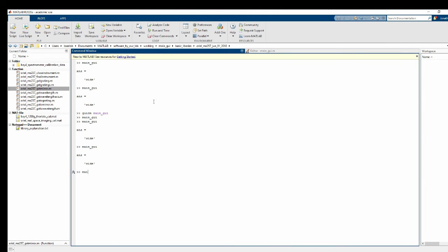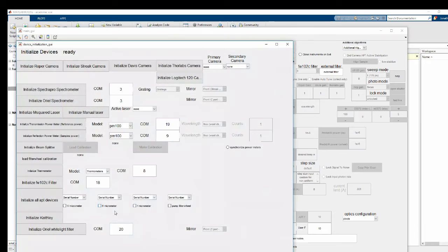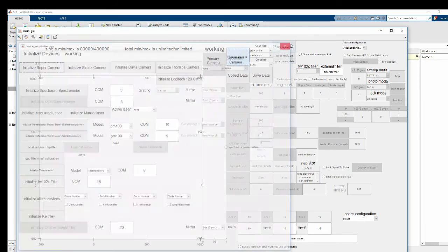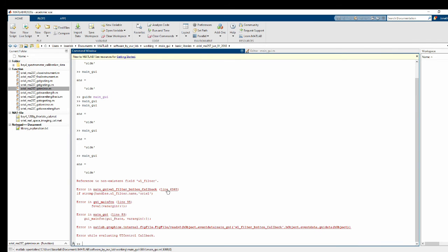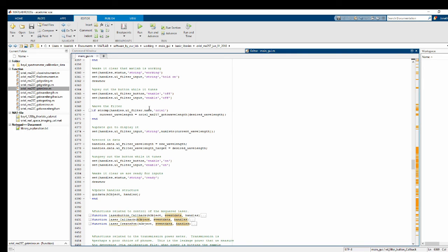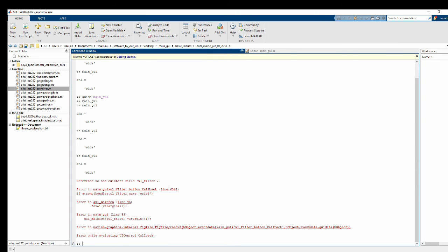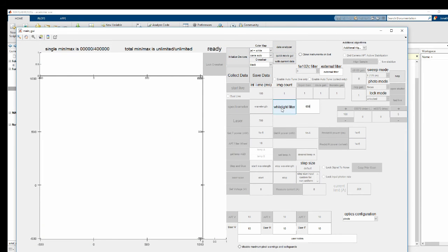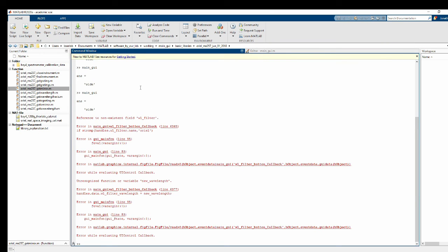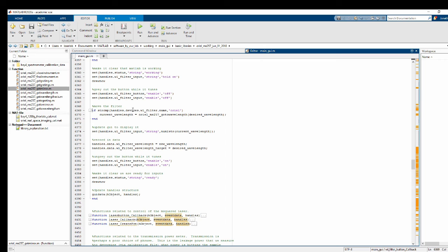Let's test it out. All right. Let's see what happens if I tell it to go to 650 pass-through. Okay, some sort of error. Let's see. It says... because that should be handles.devices.whitelightFilterName. All right, let's try that again here. All right, I was able to hear the spectrometer turn because it's sitting just a few feet away from me. And it looks like we made another mistake here.